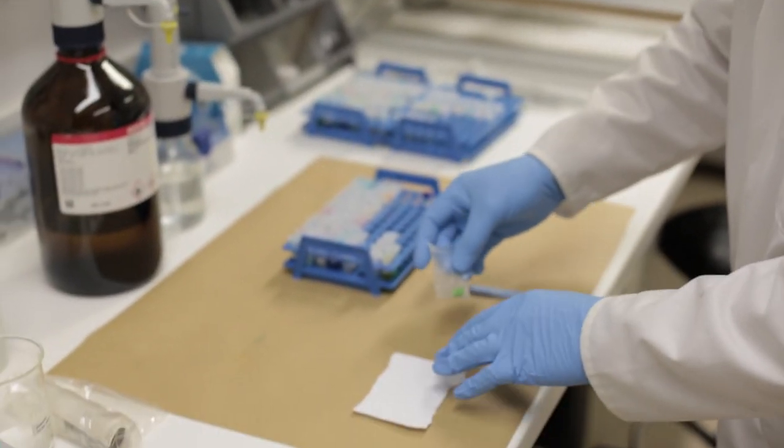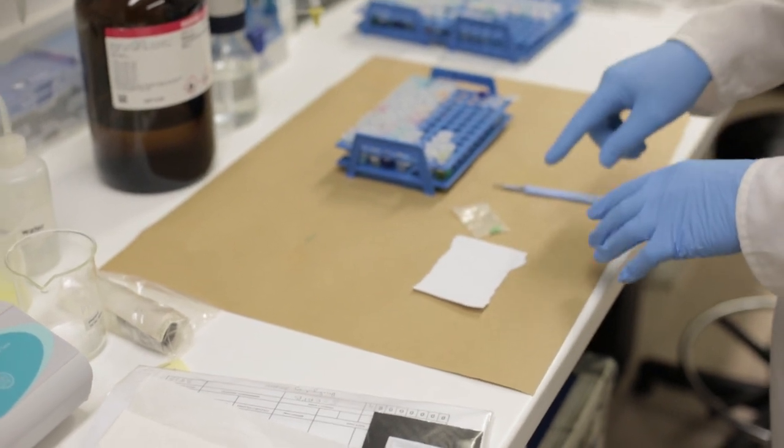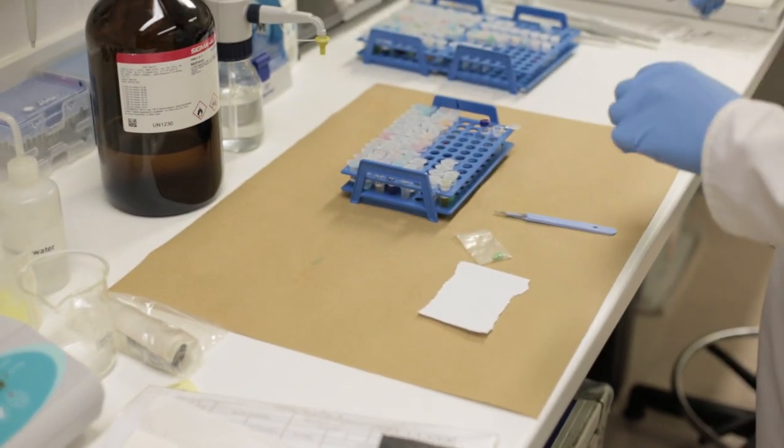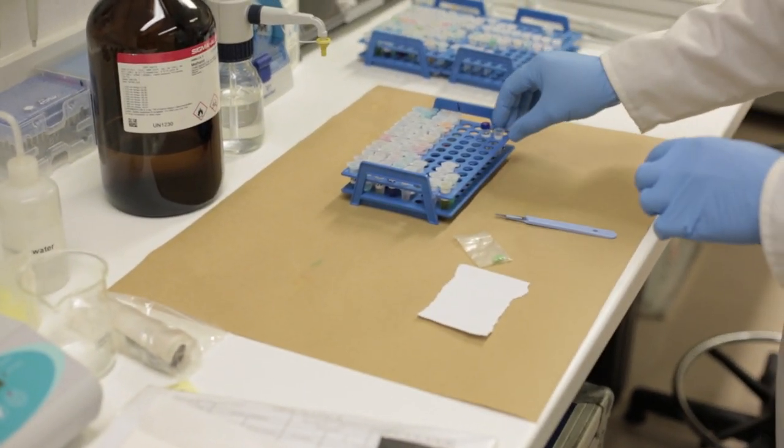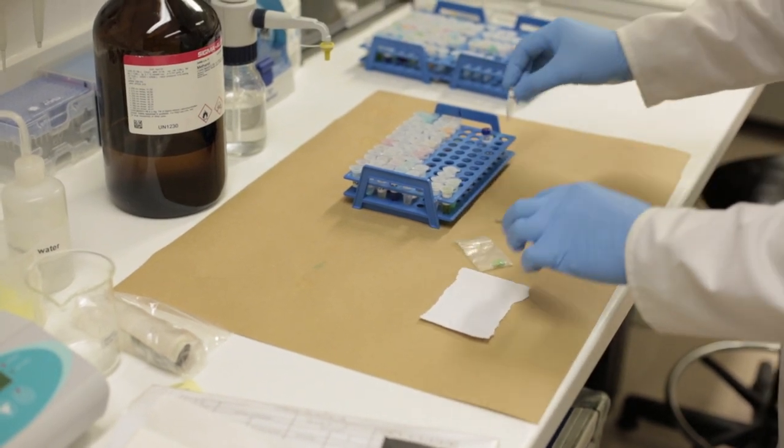So we've got a green tablet and we need to extract the drug from it and put it on the mass spectrometer so it can identify it for us. So we're going to take a small amount of the tablet.